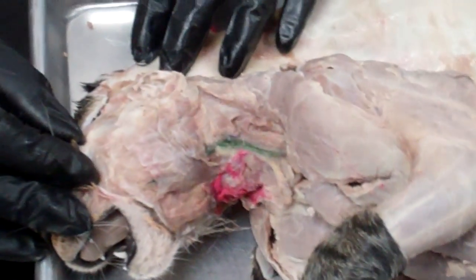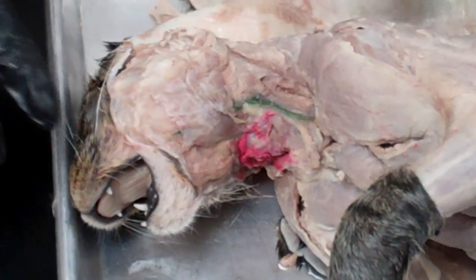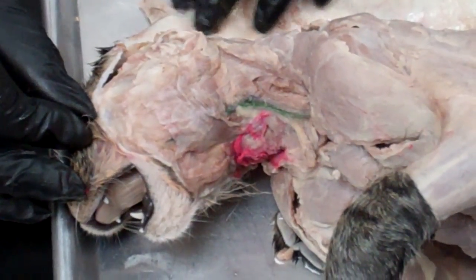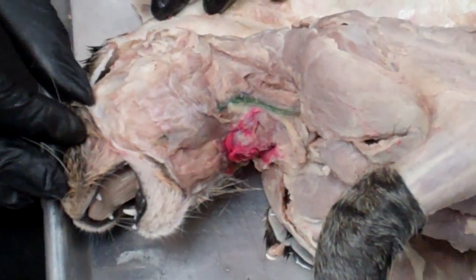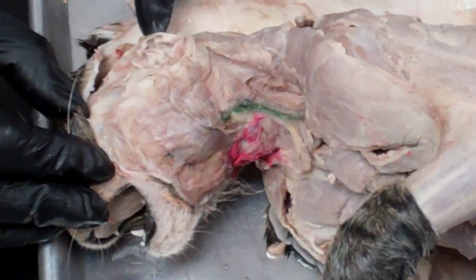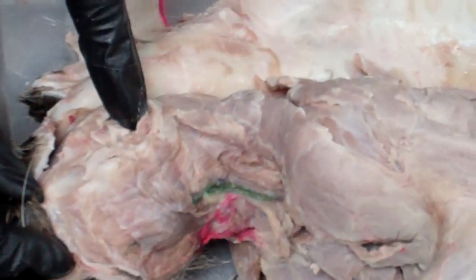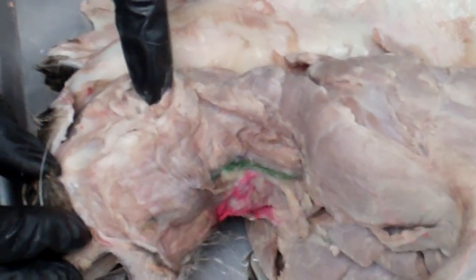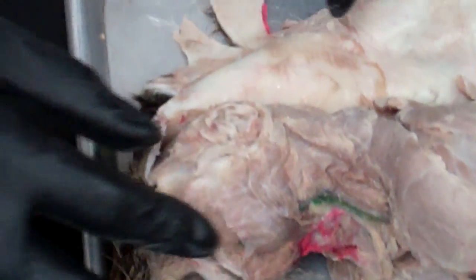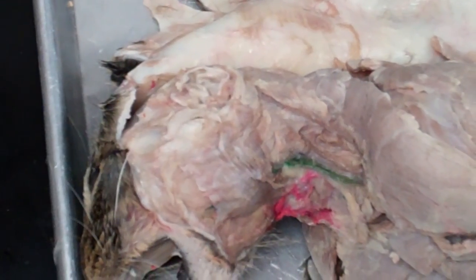The first part of our digestive system dissection covers the structures found in the cheek of the cat. You should have removed the skin and cut off the ear, so here is the hole where the ear was.